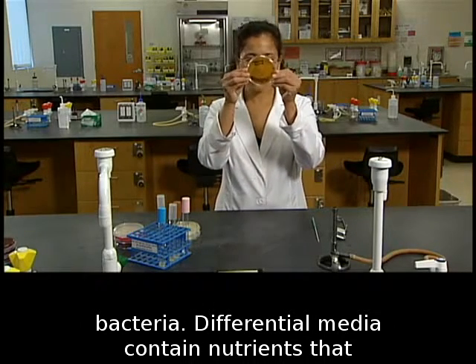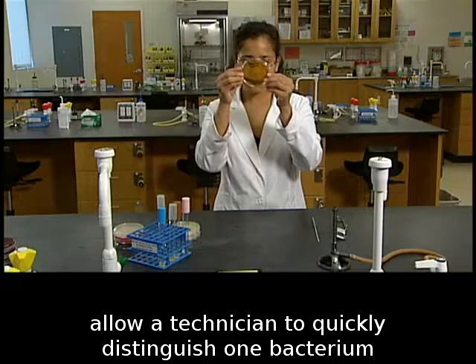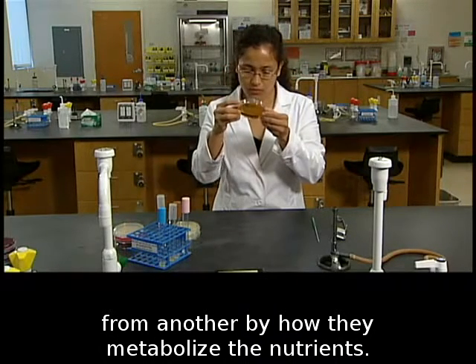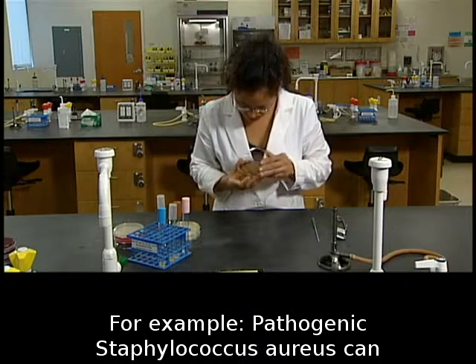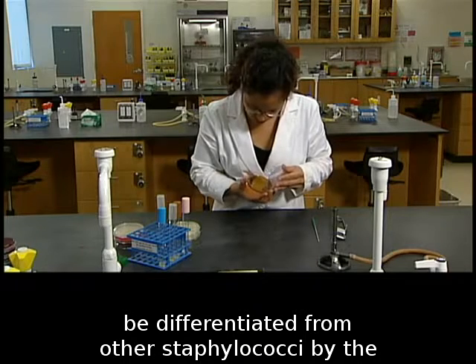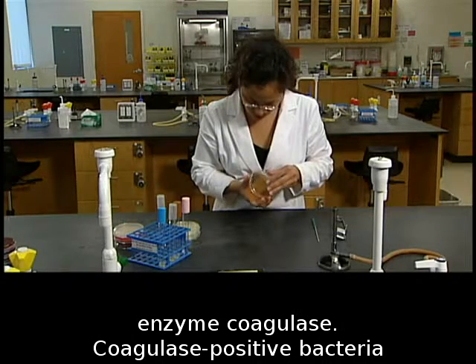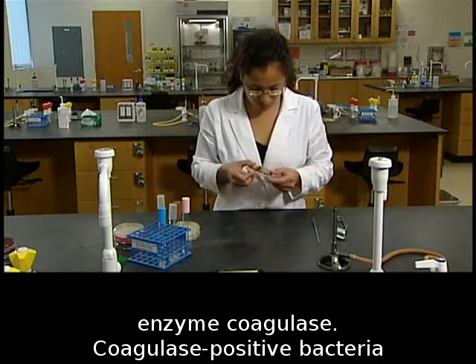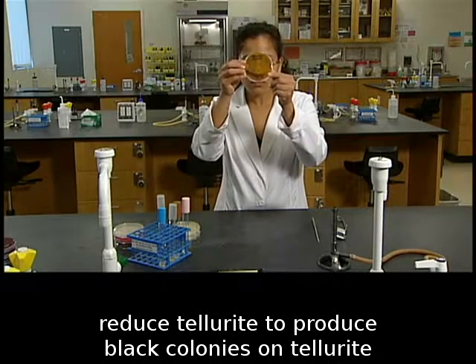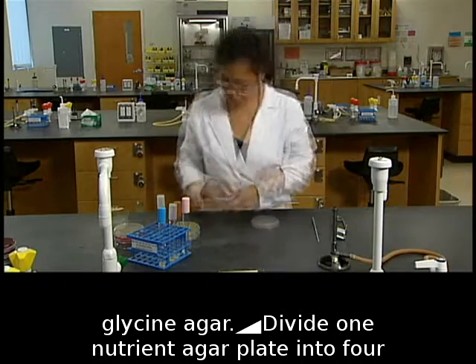Differential media contain nutrients that allow a technician to quickly distinguish one bacterium from another by how they metabolize the nutrients. For example, pathogenic Staphylococcus aureus can be differentiated from other staphylococci by the enzyme coagulase. Coagulase-positive bacteria reduce tellurite to produce black colonies on tellurite glycine agar.